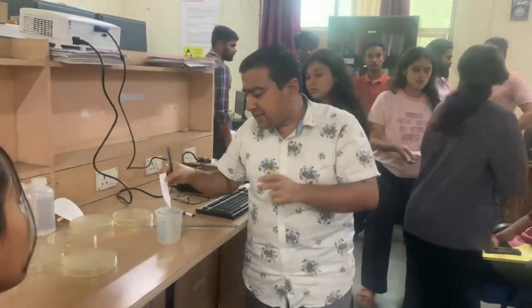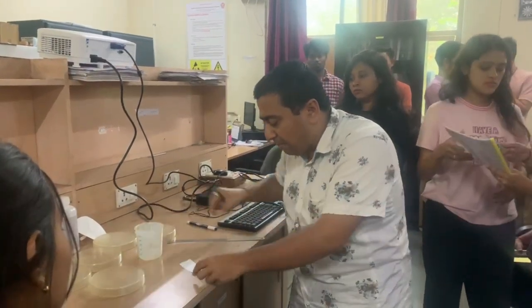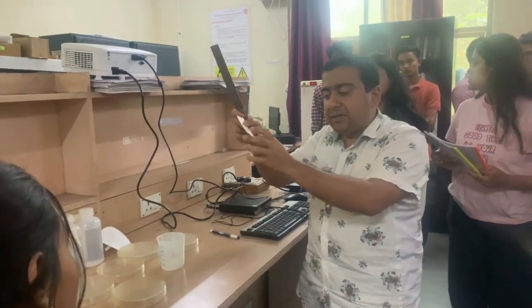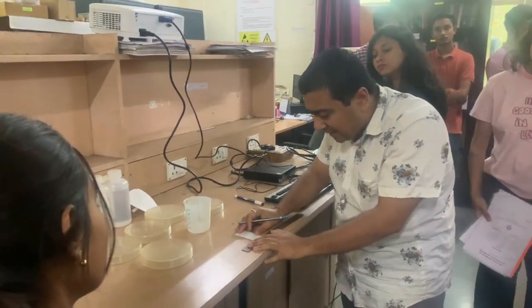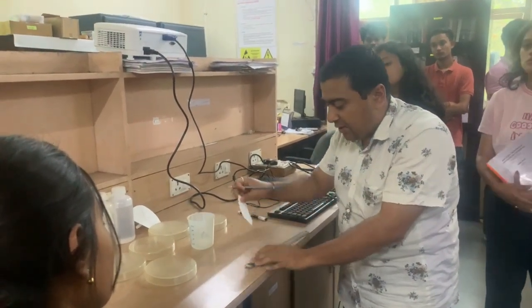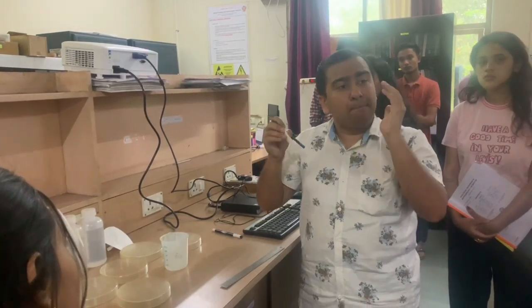Chromatography, one is the paper strip and another is called the radial chromatography or the circular chromatography. In this kind of paper strip, what we will do is mark a 2 centimeter line. From the base, in this region where the straight path starts, we will first mark it with a scale. Not exactly, but approximately it should be a straight line. So we mark it here. Why do we mark it? Because we need to create a baseline, as I told you. In any chromatography technique, you have to have a baseline, especially for paper chromatography.